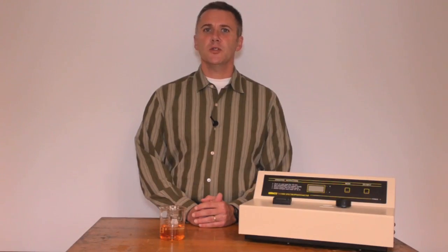You'll collect about 10 to 12 data points of different intensity of light and then use a derived equation to estimate Kc. Don't get too scared of the equations and the derivation in your laboratory manual. We'll use equation 7 and the plot associated with that equation to help estimate Kc.